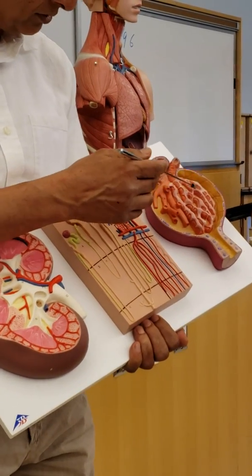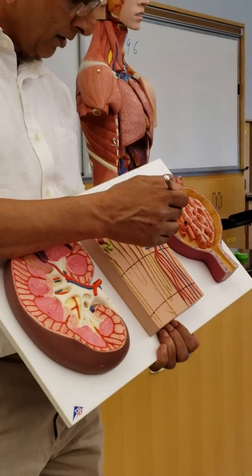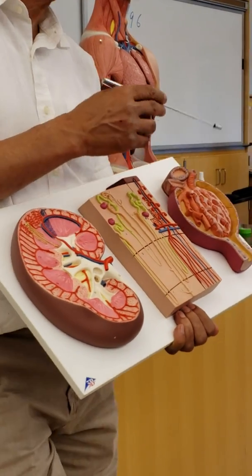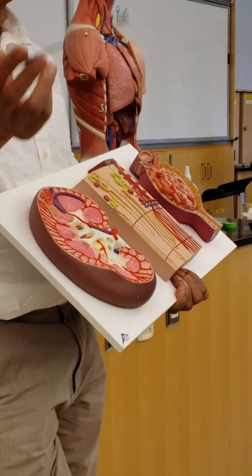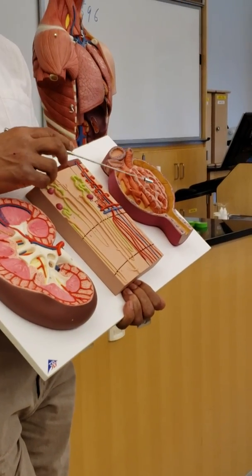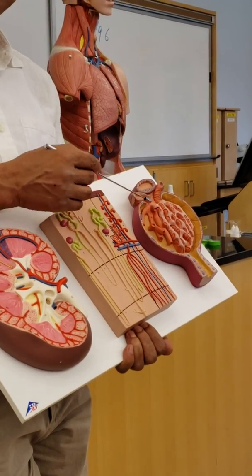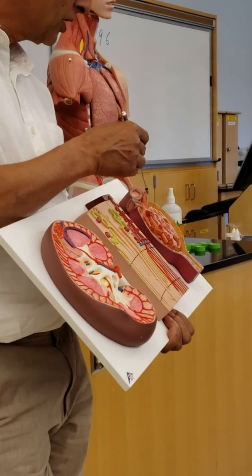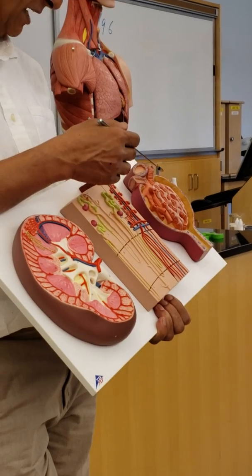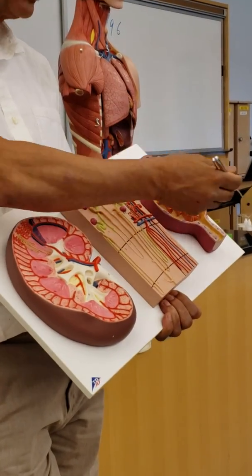And you see the glomerulus here, right? Bunch of capillaries, glomerulus. And you see here the bigger one, the smaller one. How to identify whether it is afferent or efferent? Afferent is bigger, efferent, exit is narrow. So this is bigger one, so it must be afferent with an A arteriole. The narrow one, smaller one is the efferent. So that creates a pressure in the glomerulus because exit is narrow, so you're basically forcing. You force, and it gets filtered here.